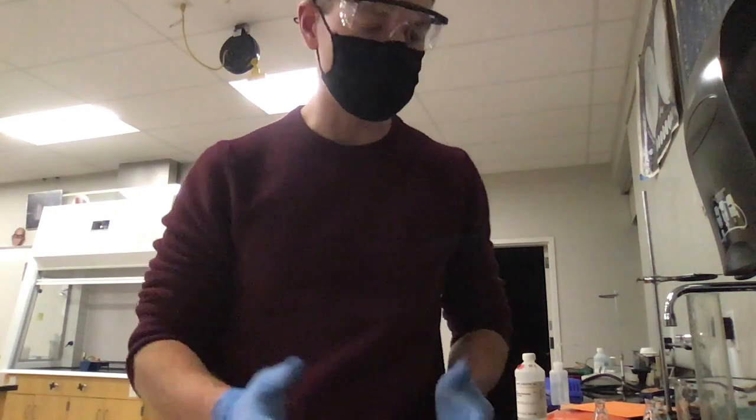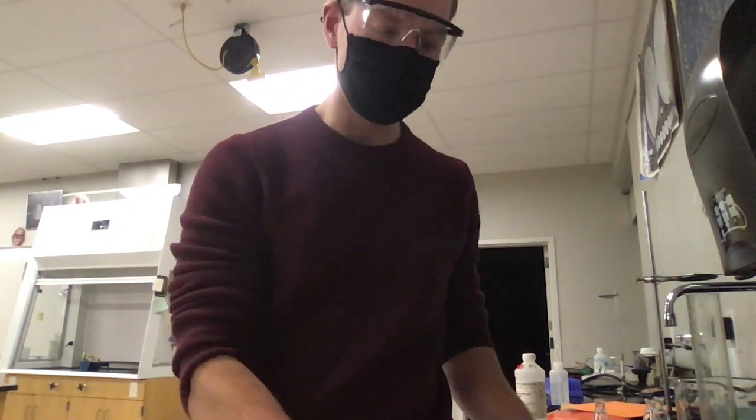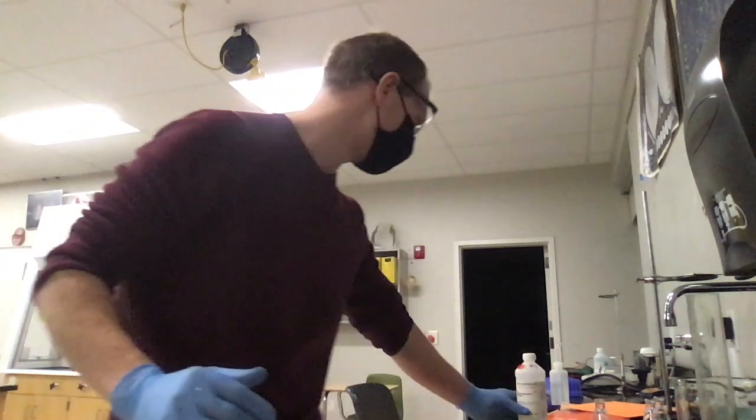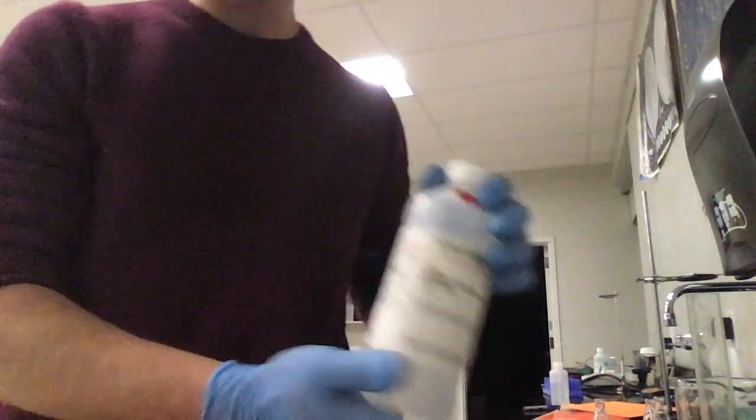Okay, so this is our first titration lab. I have my 0.1 molar sodium hydroxide. I have my unknown acid.